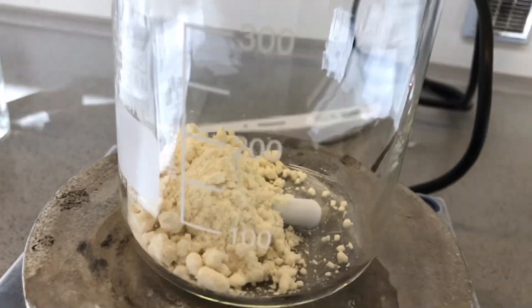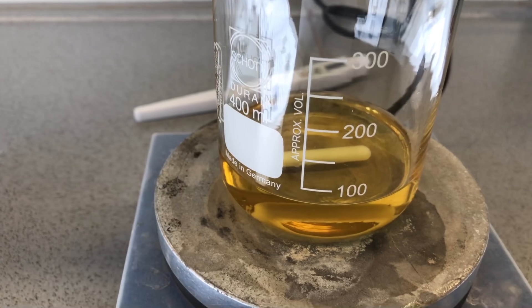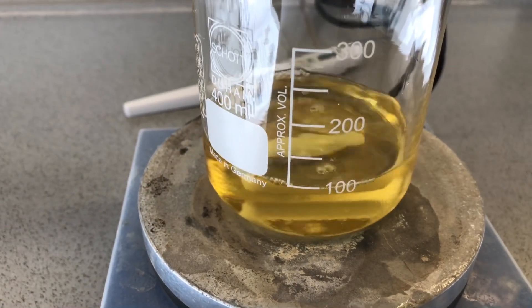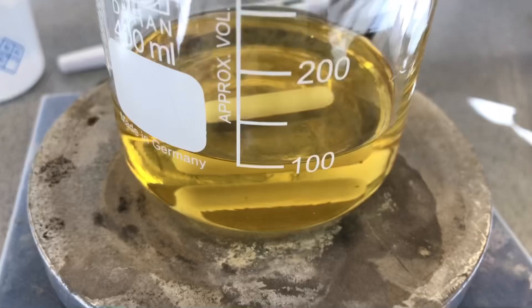The nitrobenzaldehyde was added to a beaker, followed by about 90 milliliters of acetone. The acetone is one part of the reaction, but it also acts as a solvent.